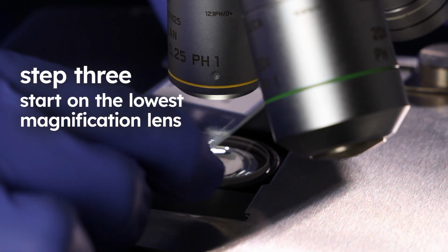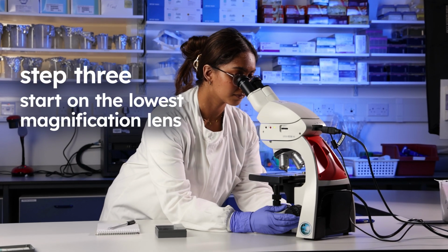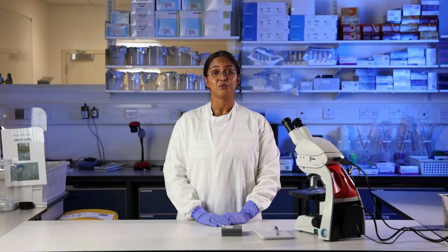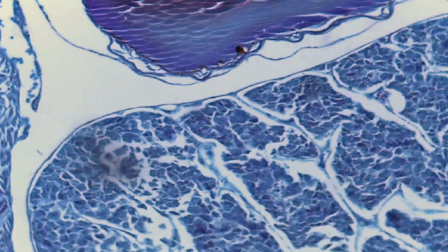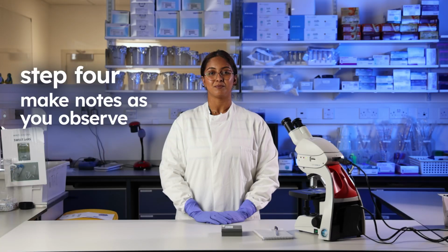Place the slide on the microscope and start looking at it with the lowest power objective lens. Move the slide around until you've seen the full picture. Each time you move up the objective lens, refocus and look around. Different structures are visible at different magnifications, so don't stay stuck on just one lens. Make notes as you observe.